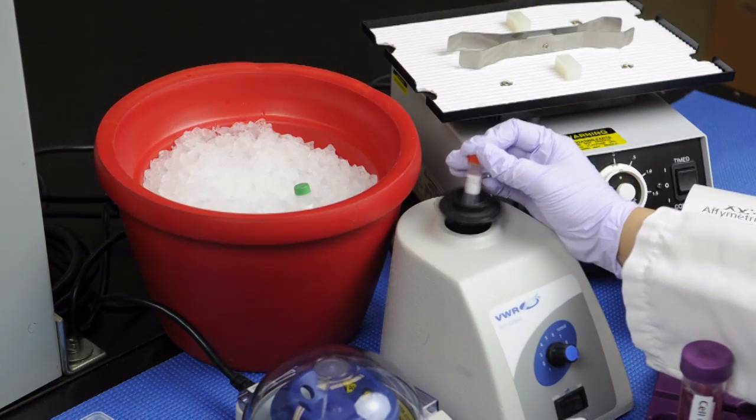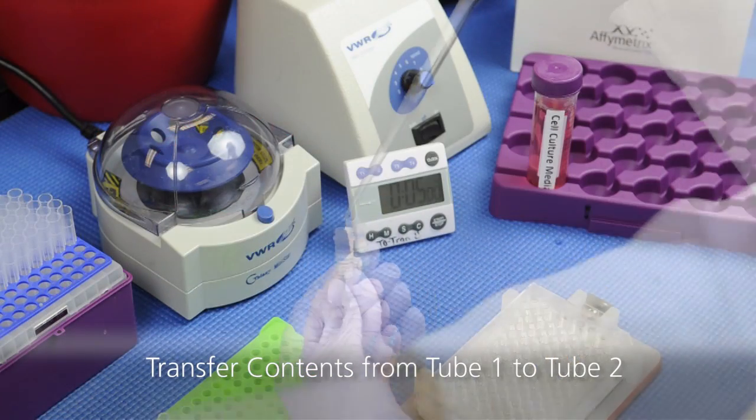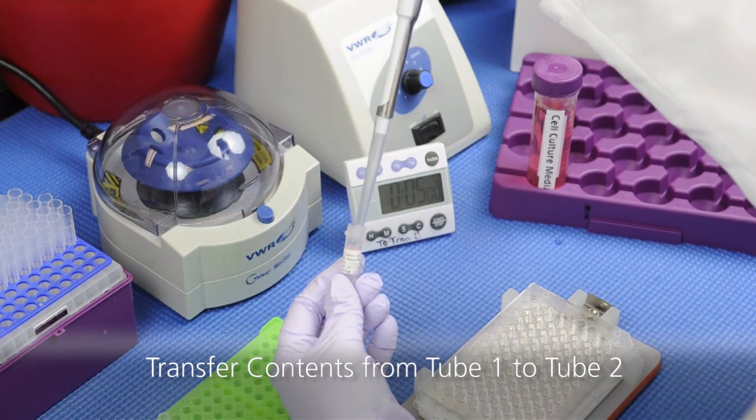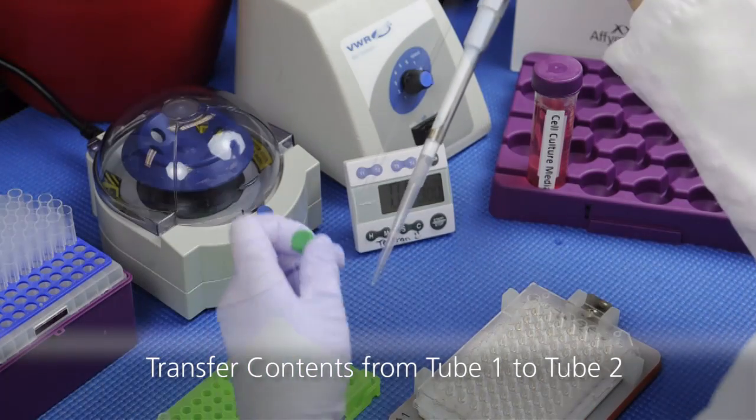After incubation, vortex gently and transfer the contents of the first vial into the second vial and incubate for 5-10 minutes on ice.